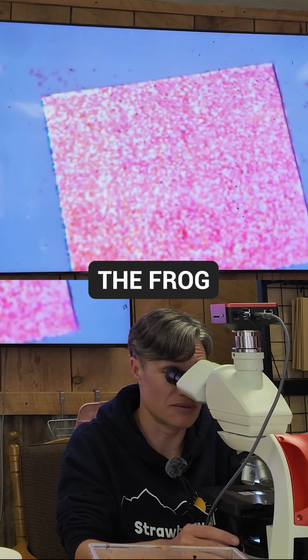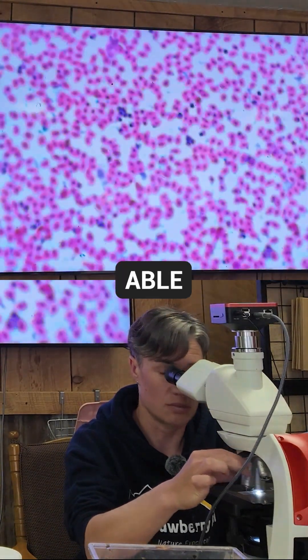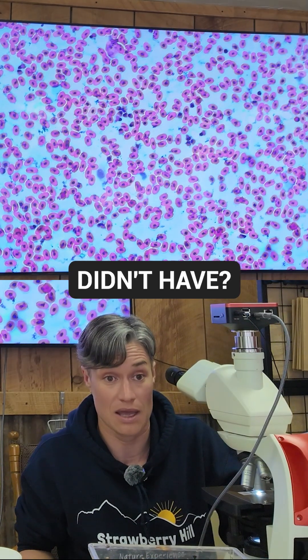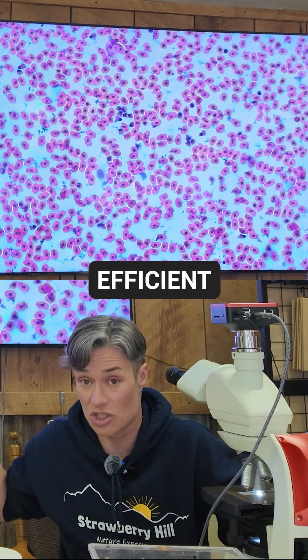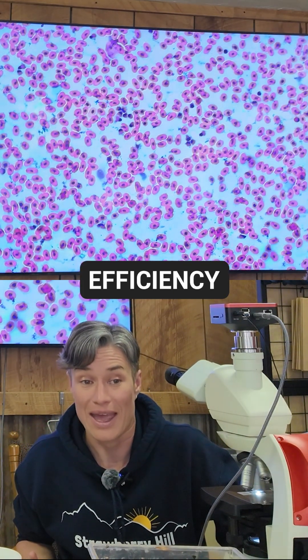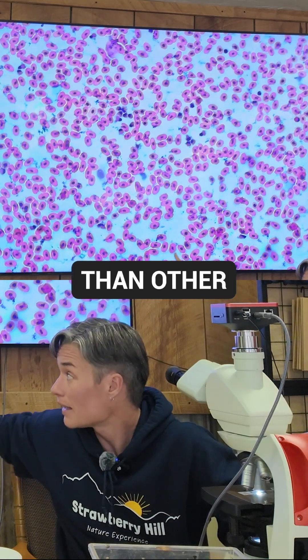There's going to be one main difference between the frog blood and human blood. Tell me what's the difference. You should be able to see it. Ours didn't have — do you remember why ours didn't have? Because they carried oxygen. So these carry oxygen as well, but these are a lot less efficient. When you look at the evolution of animals, mammals optimized for efficiency, and one of the ways they did it is that they can carry a lot more oxygen in our blood than other animals.